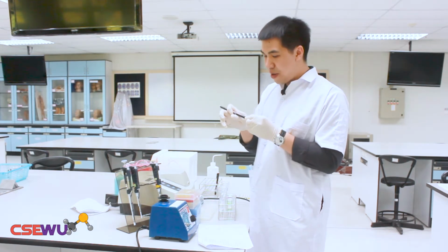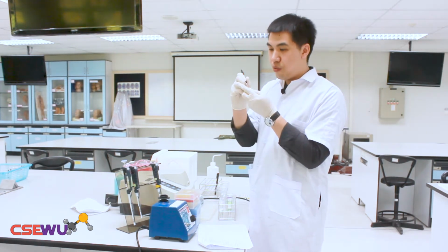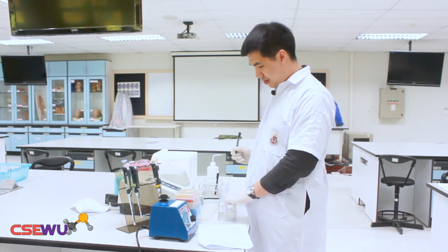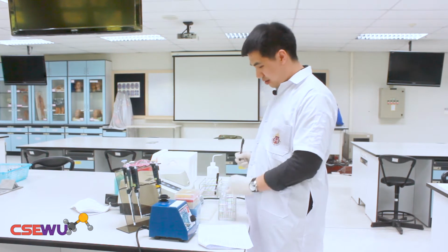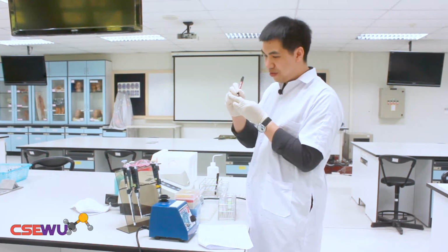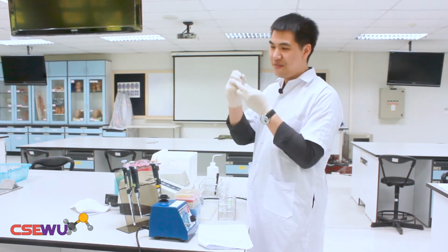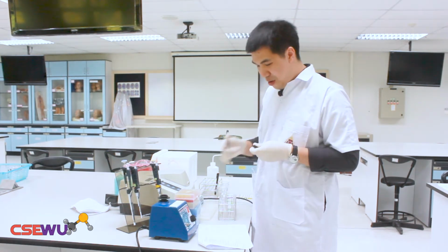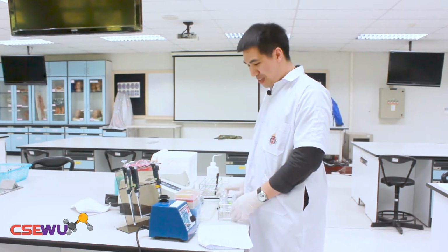So I'm going to label 5 tubes. Tube 1, 2, 3, 4, and 5. Okay, you have 5 tubes already.